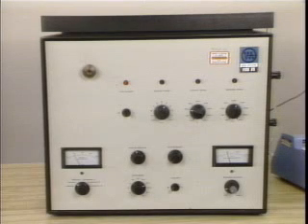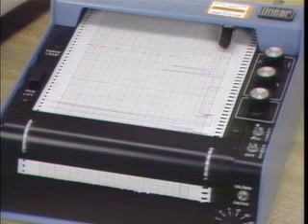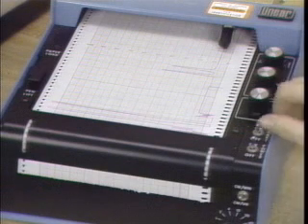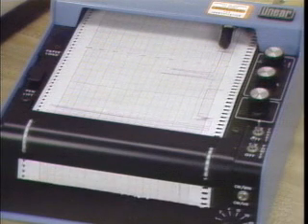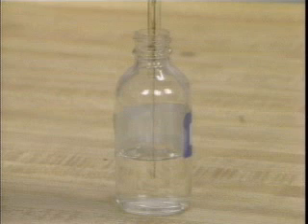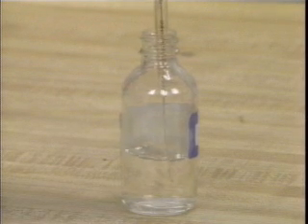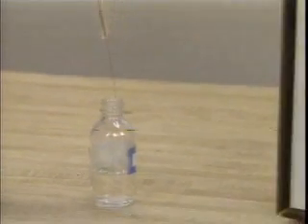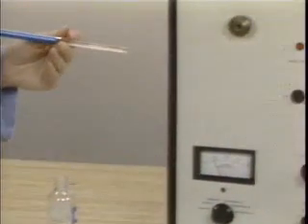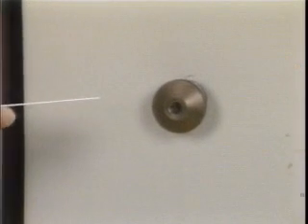At this point, all the controls on the instrument are set and the sample can be separated on the chromatograph. To conserve paper, the chart paper drive is turned on just before or as a sample is injected. To inject a sample, it is first drawn into a microliter syringe. The volume of sample used depends on the column length and diameter. For many purposes, 1 microliter of sample is sufficient.